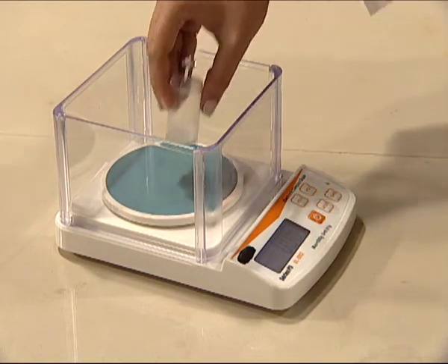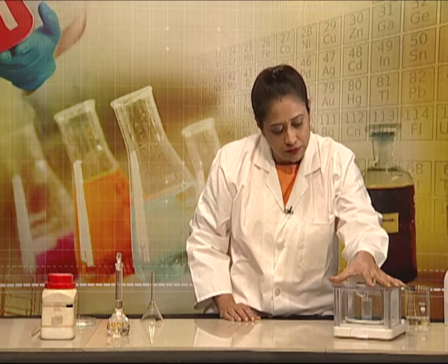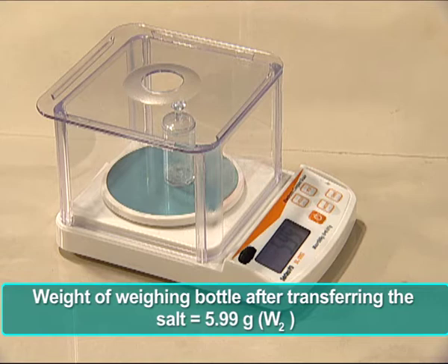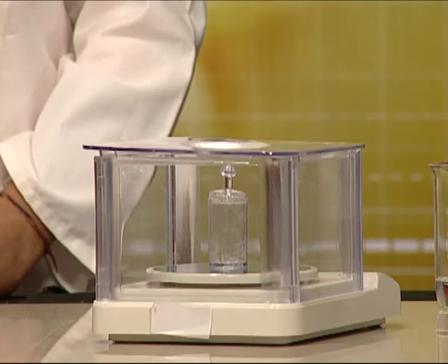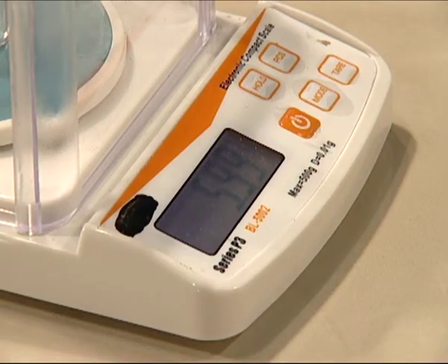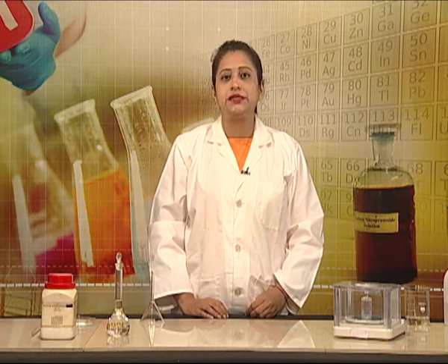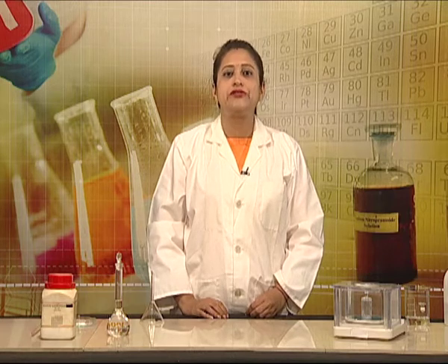We place the weighing bottle back on the balance and check the reading. We can see it is 5.99 grams exactly — the same as the initial weight of the weighing bottle. That means the complete salt has been transferred to the flask, and hence the molarity of the solution works out to be 0.05 molar.